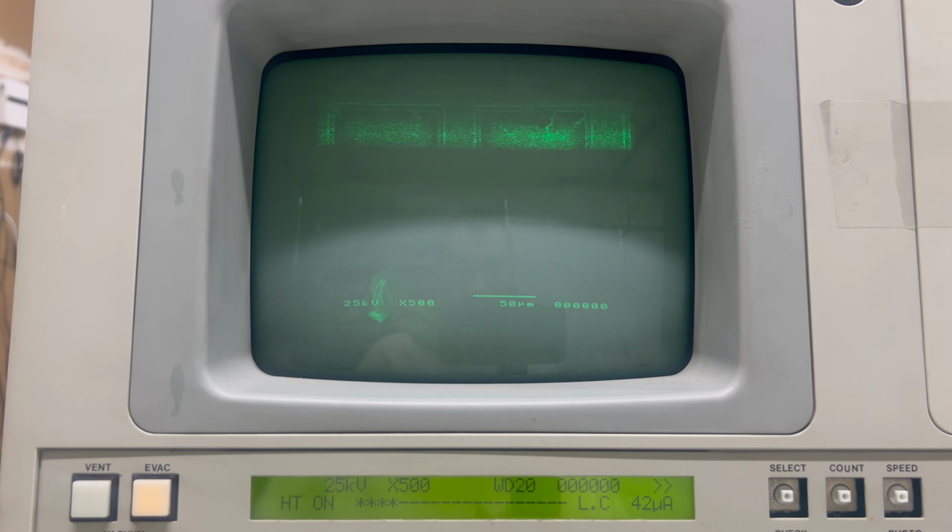This mode slows the scan rate down to about 1 frame per second. It also displays some useful information on the screen as well. It's a little hard to tell the difference, so let me zoom in a bit. This is a close-up in the fast scan mode. Now watch what happens when I slow down the scan rate. Check out how crisp those edges are now.